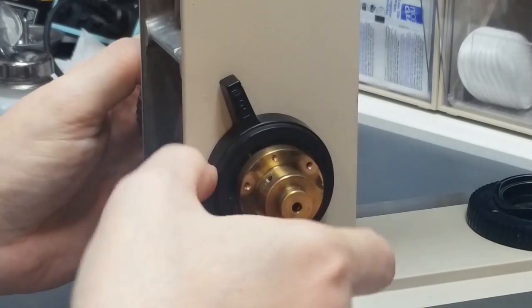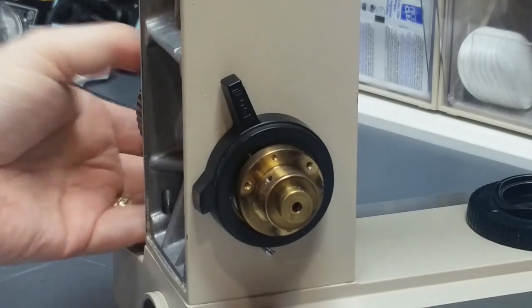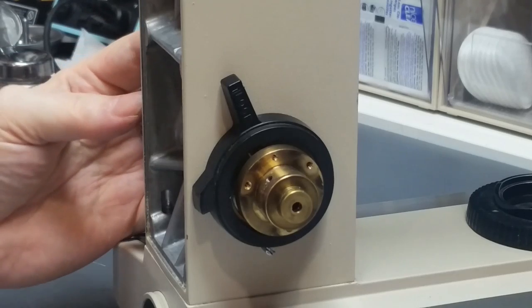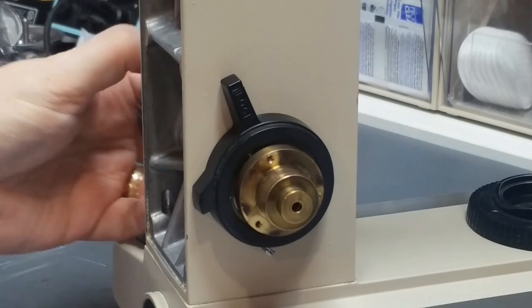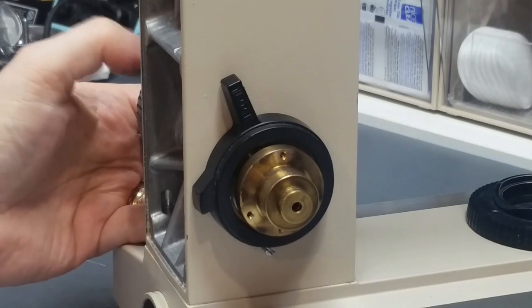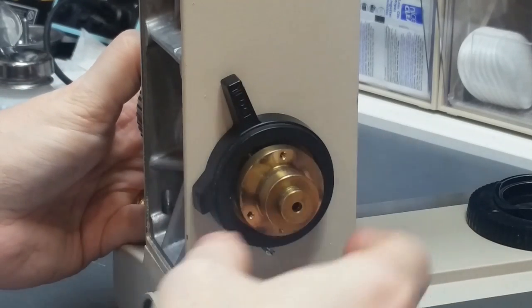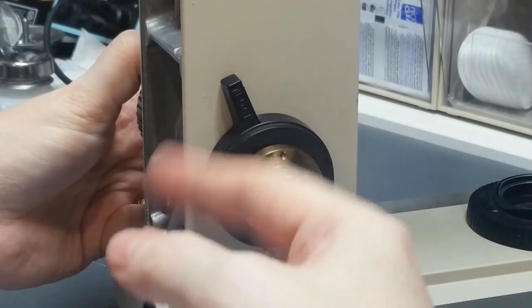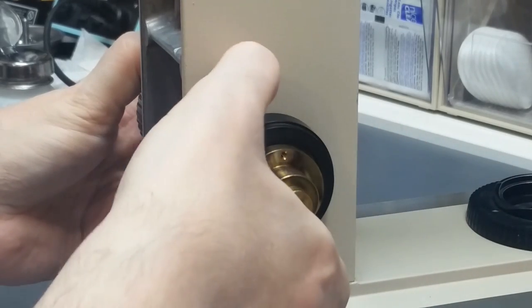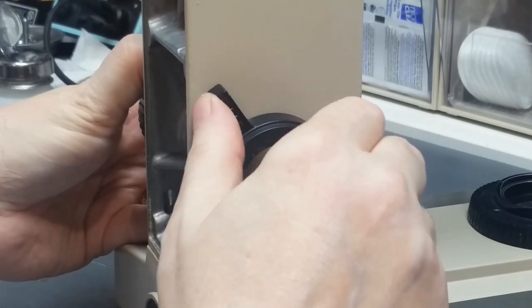Let me say that again. Lock it down, verify that it won't rotate in one direction because the two pins are hitting each other. Then rotate this thing maybe a quarter of a turn or so. And then hold the knob so that it stays in that position, and release this thing. If this mechanism is working right, when I release this, you'll hear that stop spin around and slap. That's exactly what it should do.